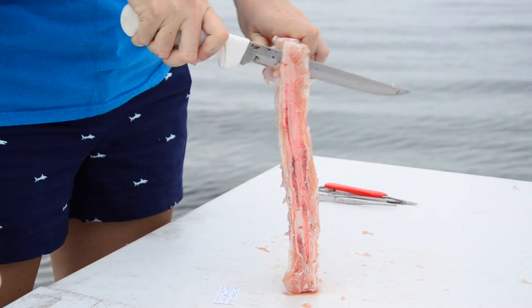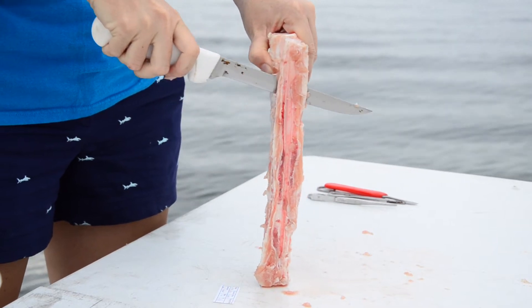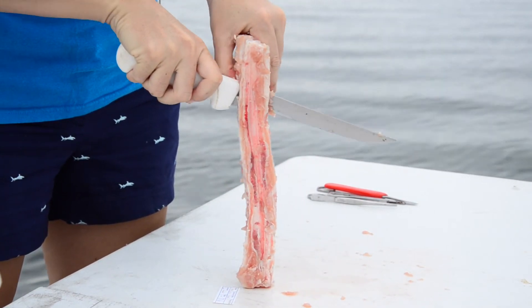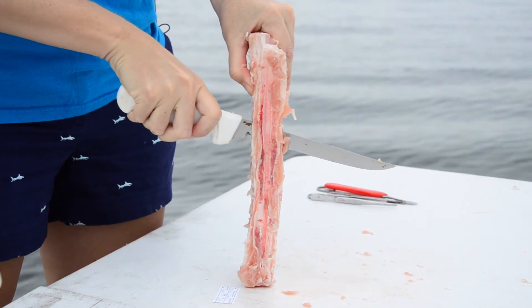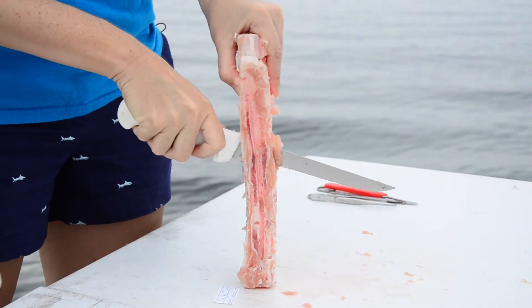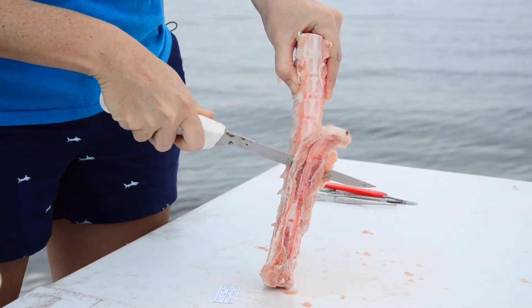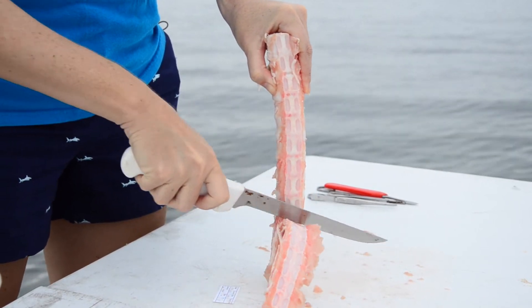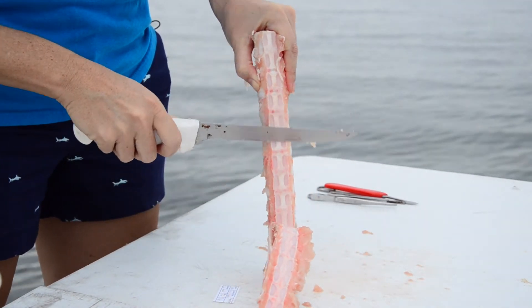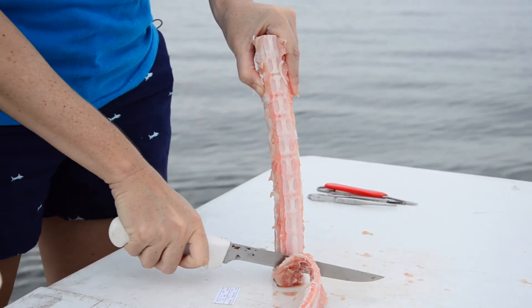It's very difficult to actually hurt the vertebrae. If you encounter resistance it's extremely difficult to cut — you're probably encountering some of the cartilage, so just adjust your track a little bit. Don't worry too much about cutting the vertebrae itself because it's very resistant.